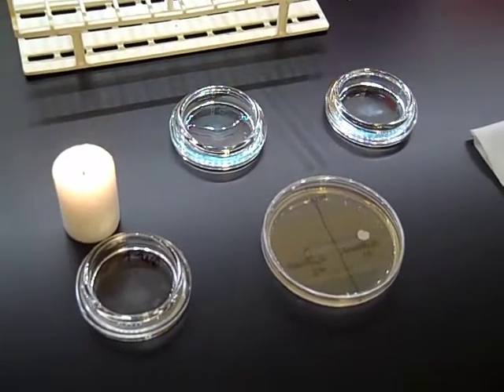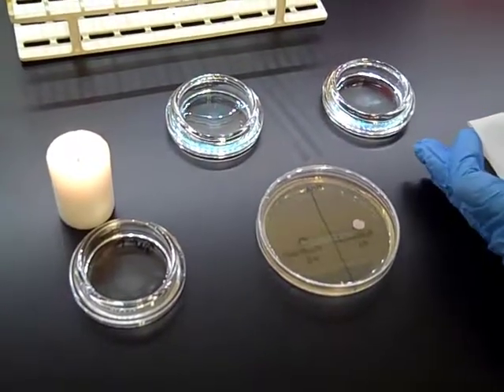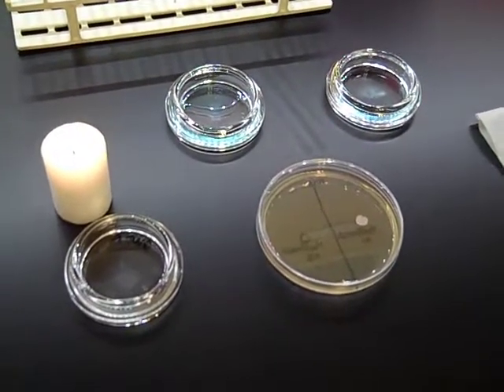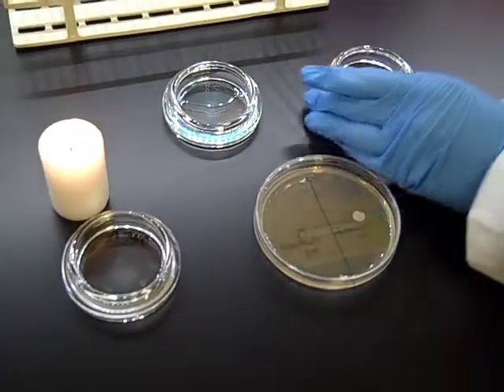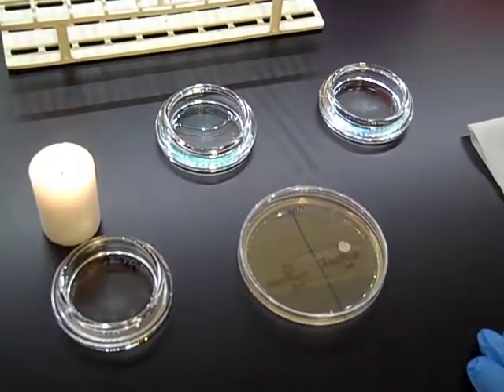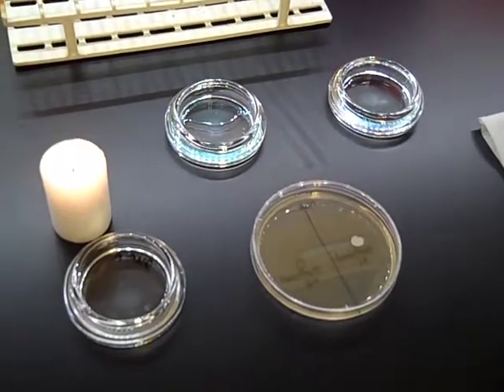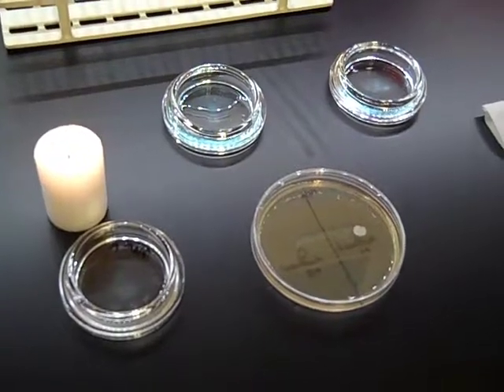If you are not comfortable with taking the filter paper disc and directly dipping into your mouthwash, just pour a little bit into a little disposable cup or a plate or something like that just so you can get a little bit of liquid on. You don't need a lot.